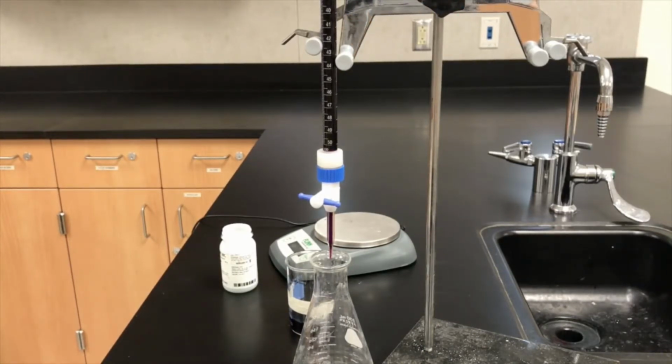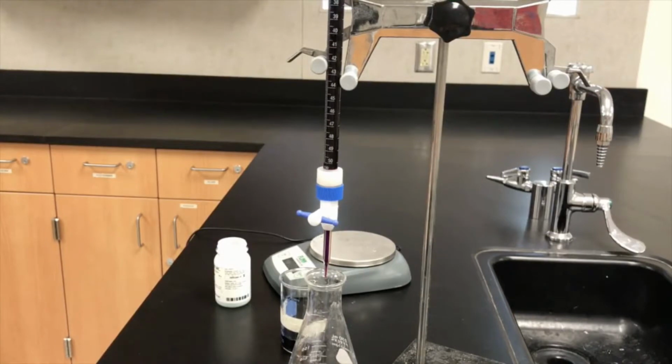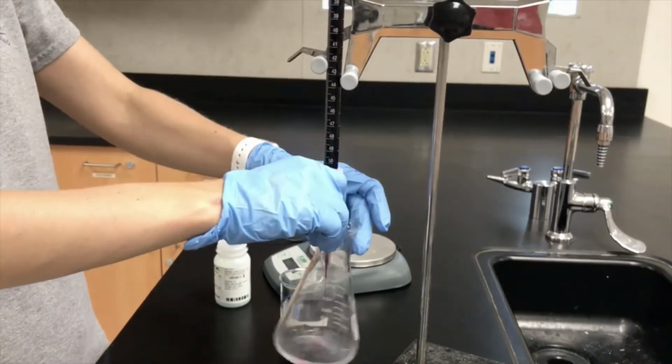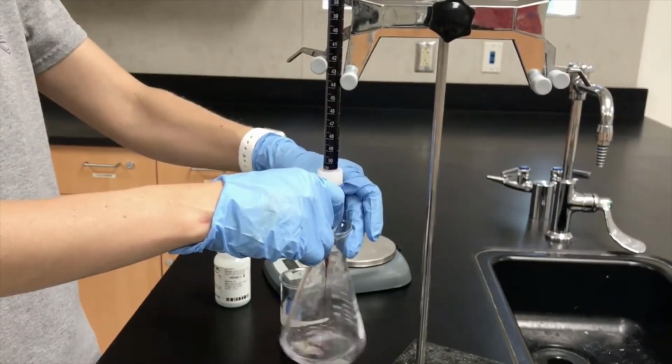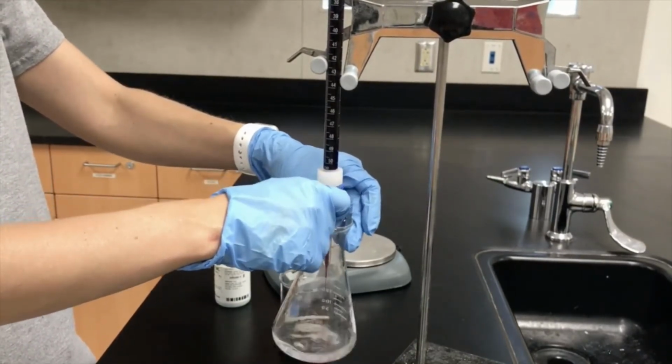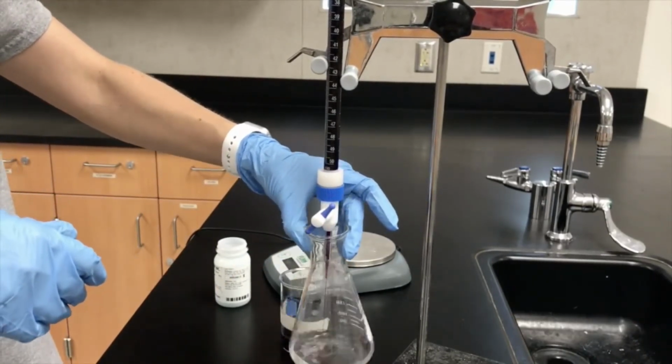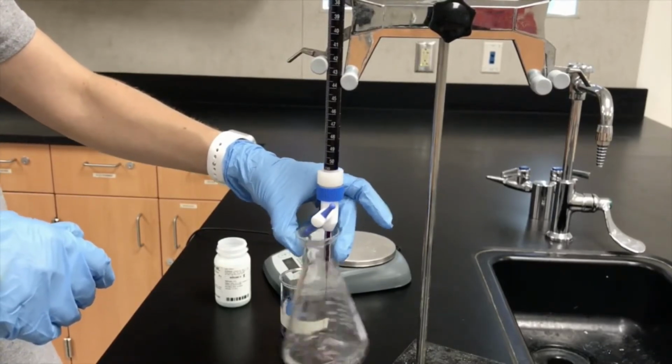Titrate the ferrous ammonium sulfate solution with the permanganate solution until the first trace of pink color persists for 30 seconds. Remember to swirl the flask and rinse the walls of the flask with distilled water before the end point is reached. Okay, so this is what it's going to look like. You're going to have it go parallel to the stopcock. You can allow it to have a steady stream at first and let it keep going until you start to see a little bit of pink linger, and then you want to add dropwise.